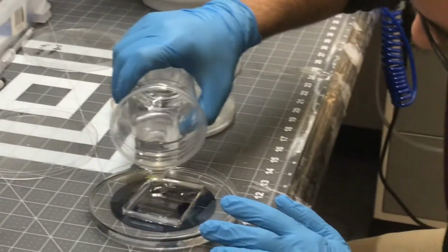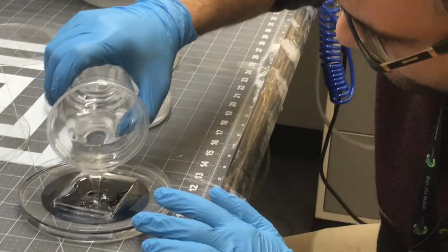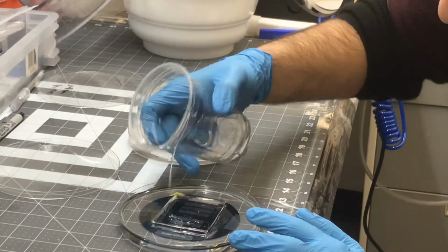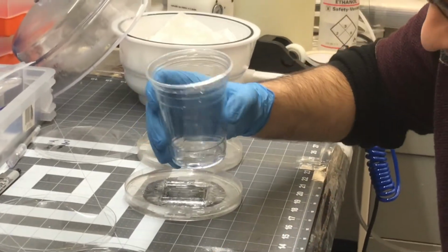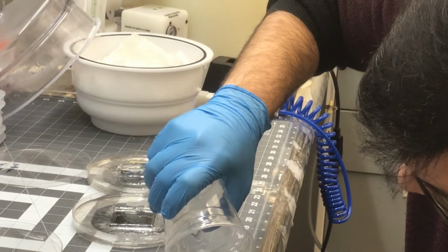This is my chip. Ali, if you had not used your chip, and, for example, Oshin had used this 4, then she would have to reduce the PDMS. Yes, only 15 grams is enough.